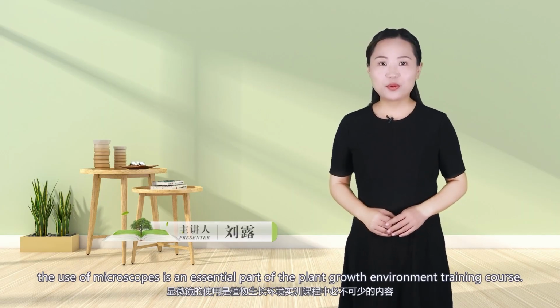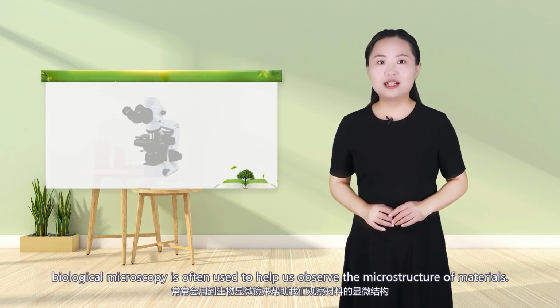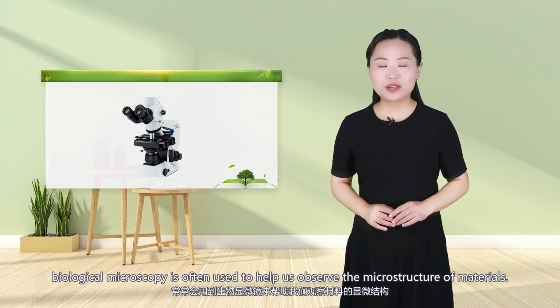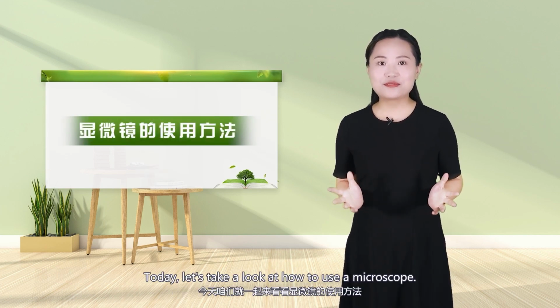Hello everyone. The use of microscopes is an essential part of the plant growth environment training course. In the observation of plant cells and tissues, biological microscopy is often used to help us observe the microstructure of materials. Today, let's take a look at how to use a microscope.